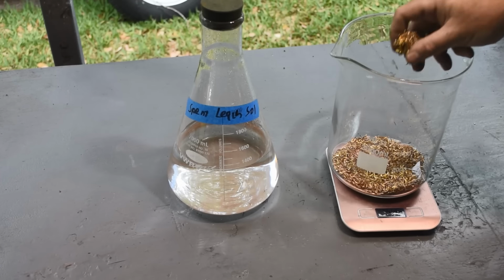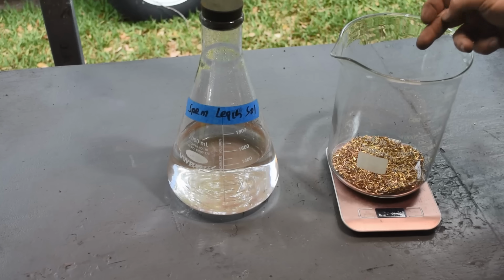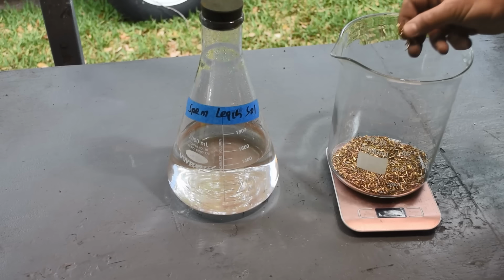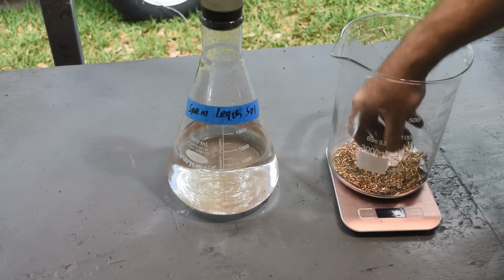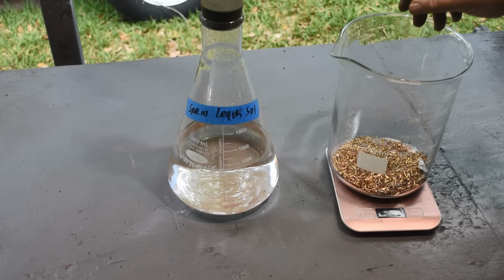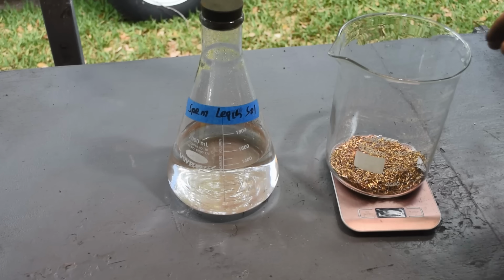That's what seems to happen. When I first put the leach on, it seems like it's going great guns after the gold. The gold gets really dull, it starts disappearing, but then it kind of stalls out and the liquid loads down with copper and tin. So I think if I don't leave the liquid on as long, so it's going after the gold initially, and then dump it off before it gets loaded down with copper and tin, and then put fresh liquid on it and do that a couple of times, maybe we'll get all the gold off without having to deal with so much copper and tin. We'll give it a try anyway. We'll give it the old college try, as they say.